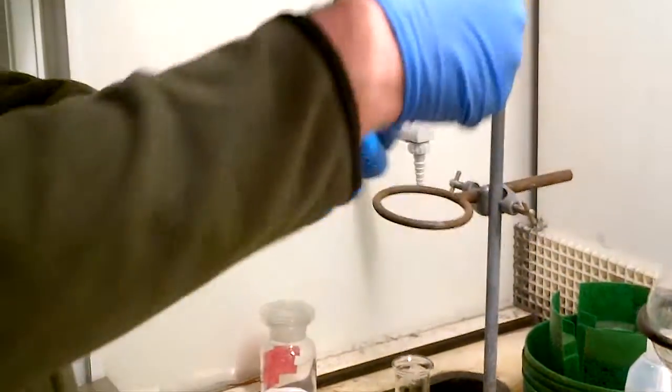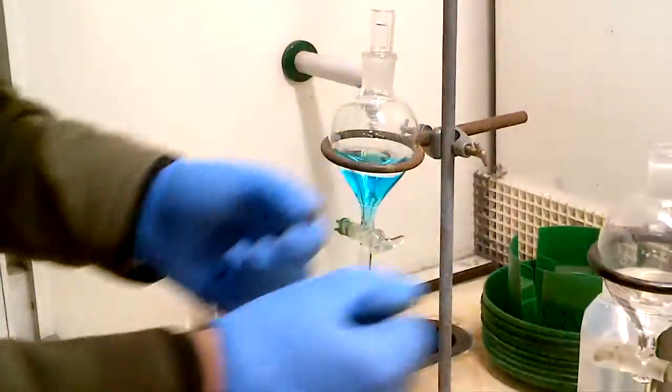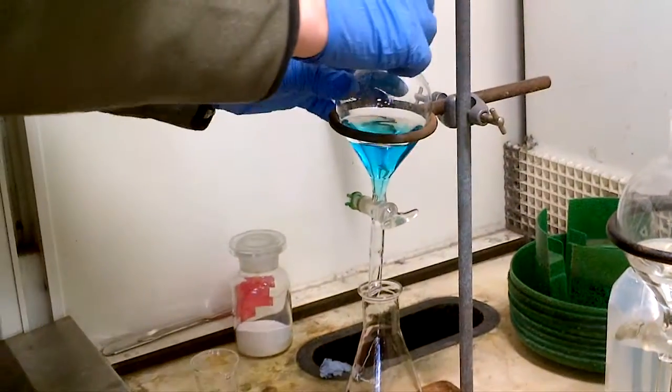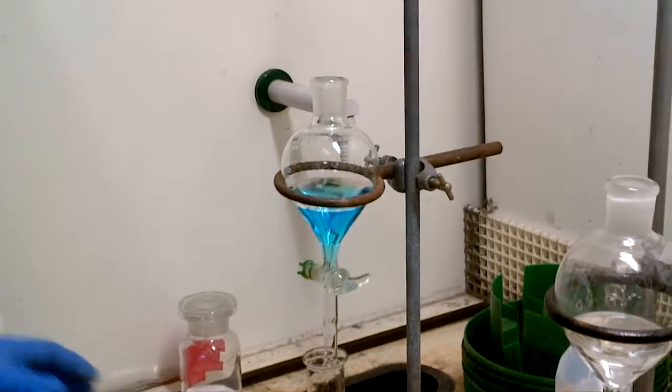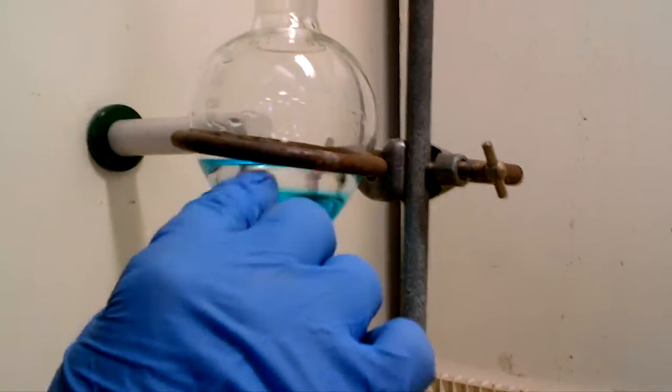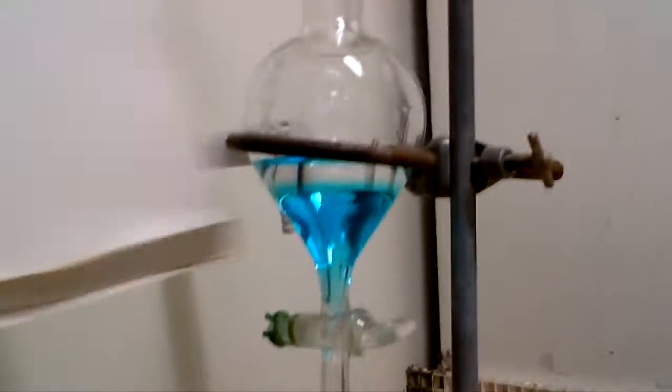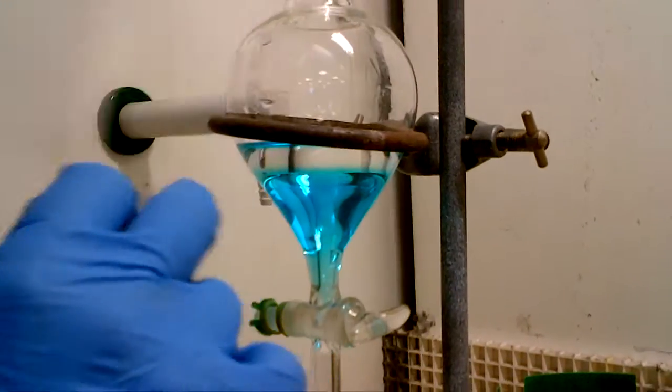So it's a gentle swirl, it's not a vicious kind of motion, not good. So, once we do that, we've now got the bottom aqueous phase, as clearly seen, bottom aqueous phase, and as well, we have the top organic phase. Okay, so I'll just put this mat in at the back, bottom aqueous phase, top organic phase.